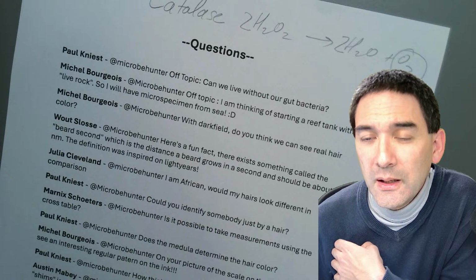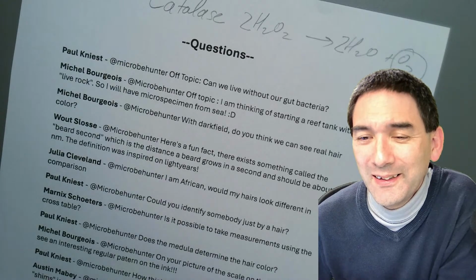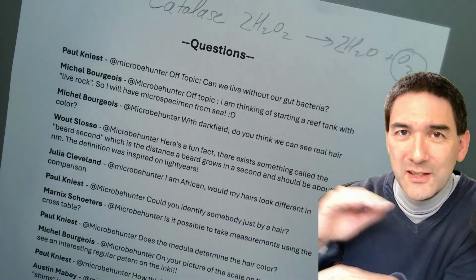Yeah. My skin looks just like that of onion under the microscope. When you have a sunburn and you get the skin off, that's the top layer of the skin.